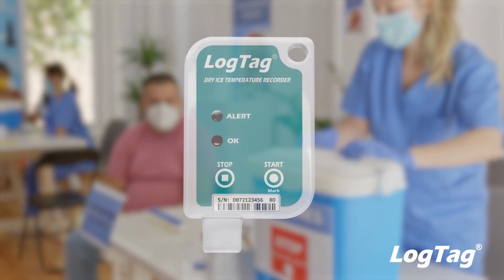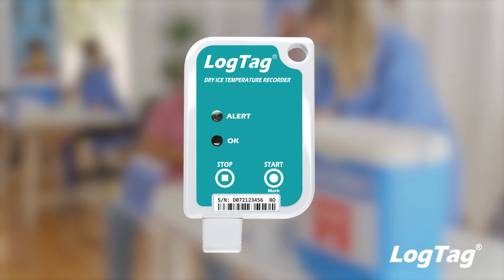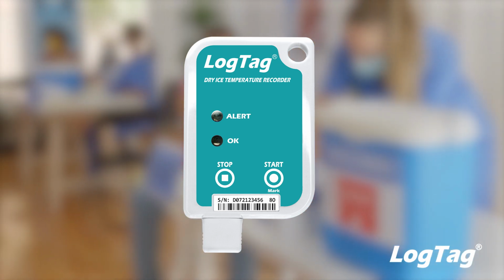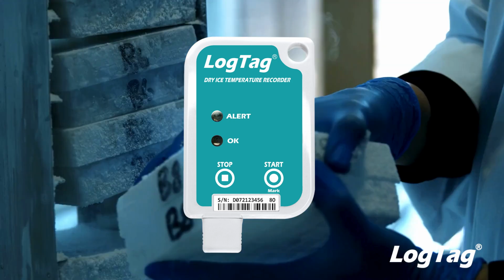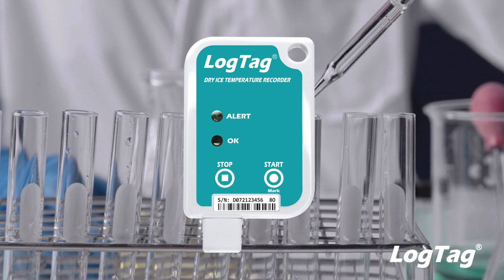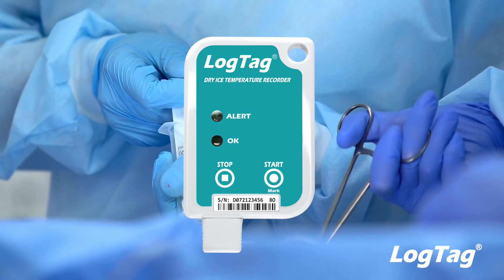The LogTag TRIL and SRIL-16U are LogTag's latest, ultra-low temperature recorders that reliably and accurately monitor and store temperature data at ultra-low temperatures. Designed and engineered for challenging environments, these loggers are the perfect solution for professionals who need to accurately and reliably monitor medical and pharmaceutical freezers and shipments utilizing dry ice.